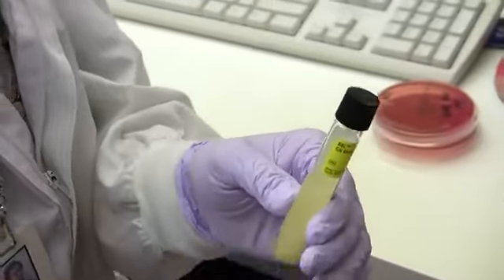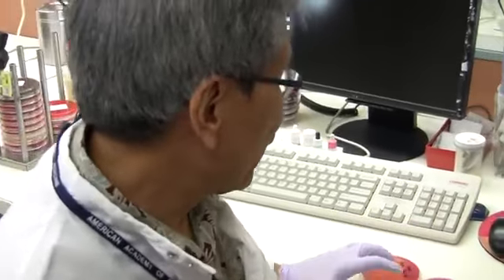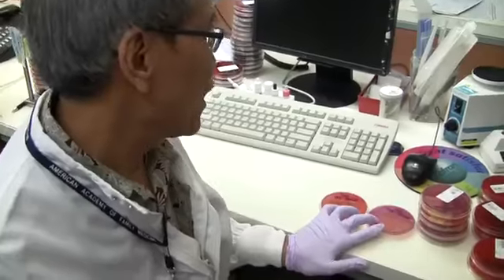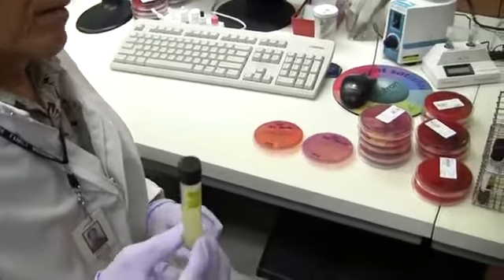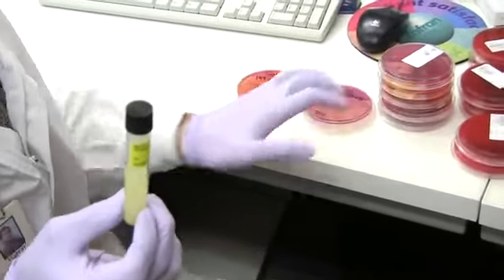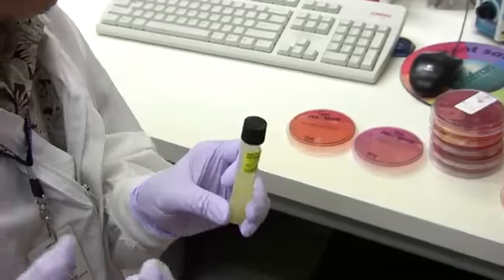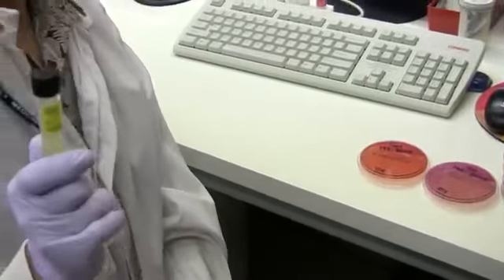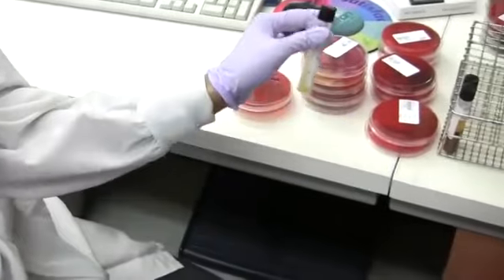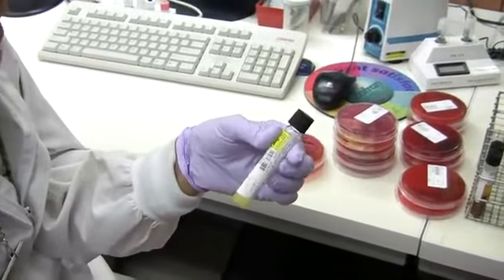After 6 to 8 hours of incubation, we subculture it into a MacConkey agar and a Salmonella Shigella agar. So that if there is something that we missed from the original stool culture, we're not going to miss it from the GN broth. So you amplify the number. With this, we just don't throw it away after subbing it to another MacConkey and Salmonella Shigella agar.